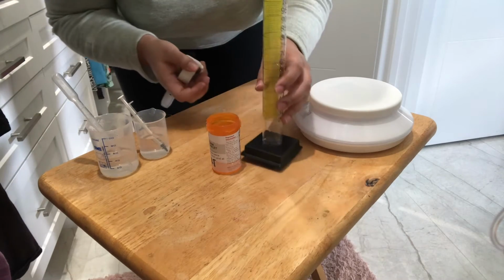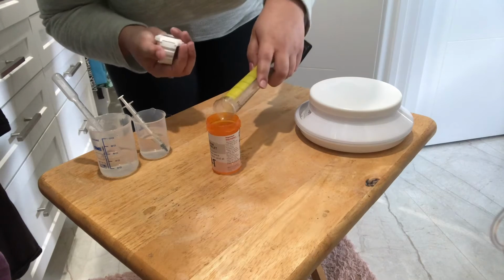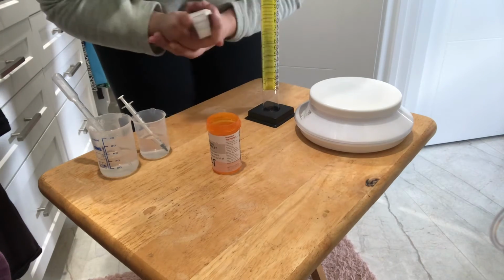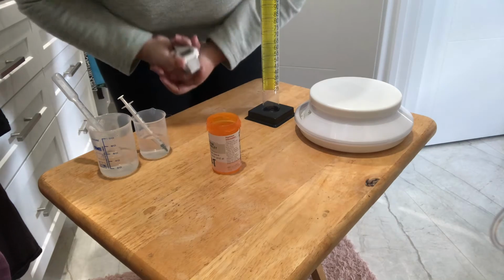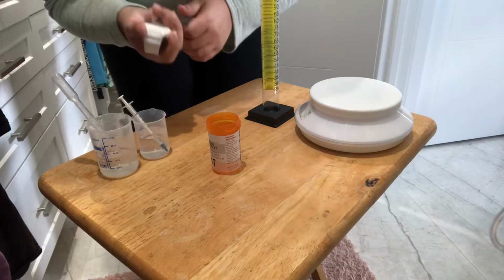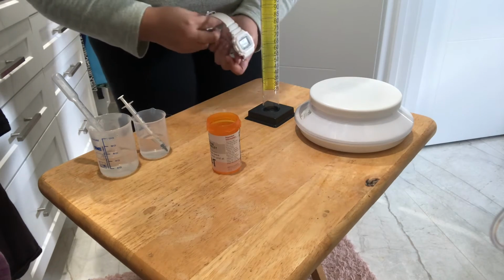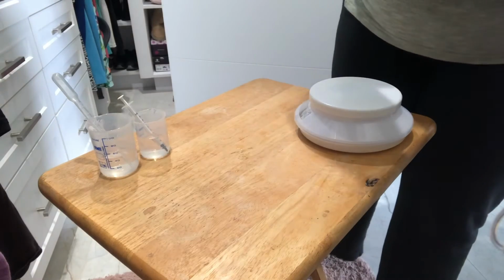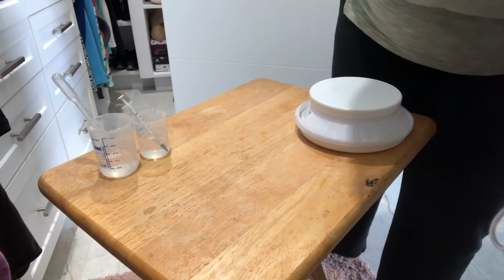So once we pour our hydrochloric acid into our sodium thiosulfate, we press the timer immediately. And once we see our yellow sulfur precipitate form, we can stop our timer. We always want to be recording our temperatures, and we're always recording our time depending on the temperature.